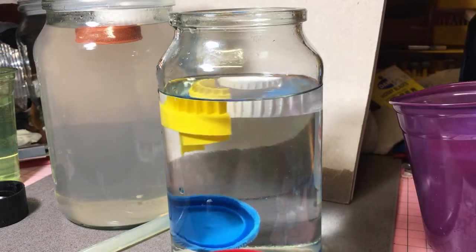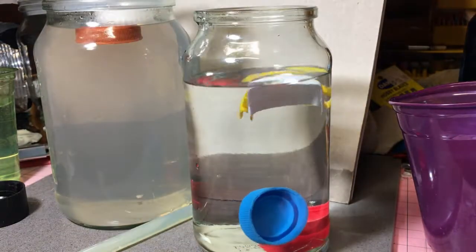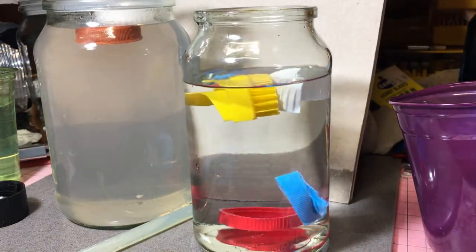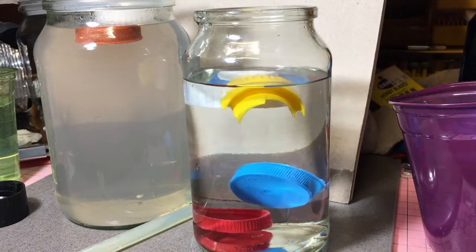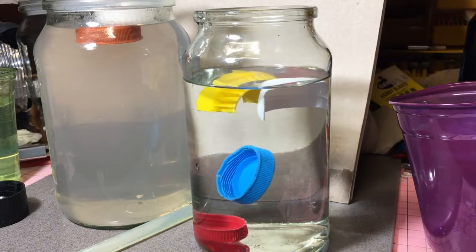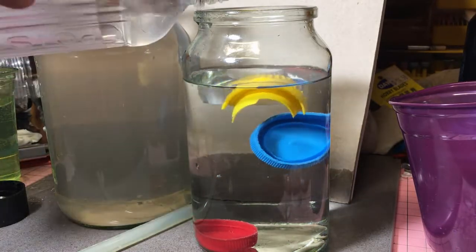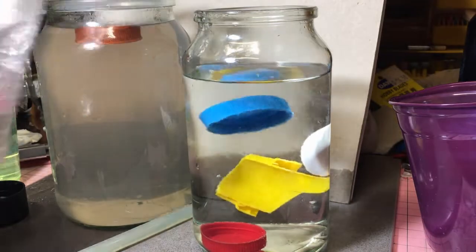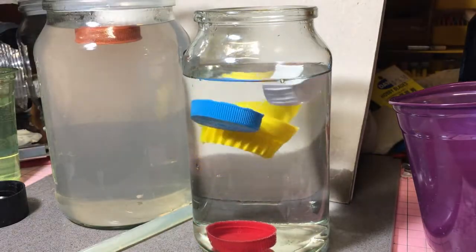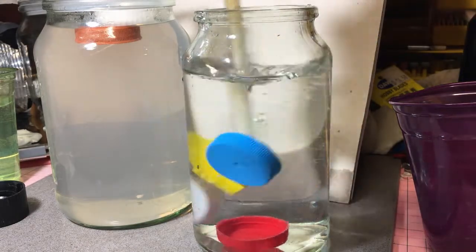So you can see there — the blue and the red are at the bottom. The red one won't come up from there, but the blue one will probably try and have a fight. It'll say, 'No, I'm not heavy.' We say, 'Yes you are.'